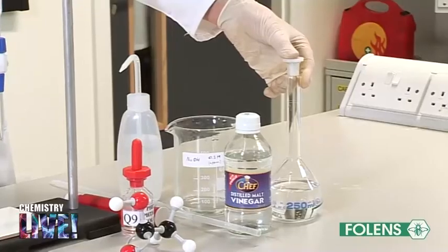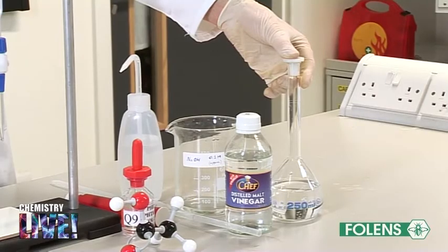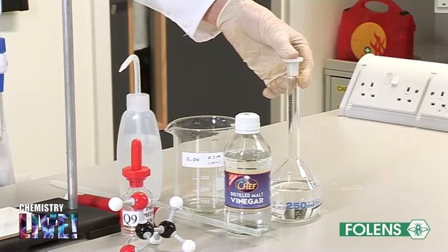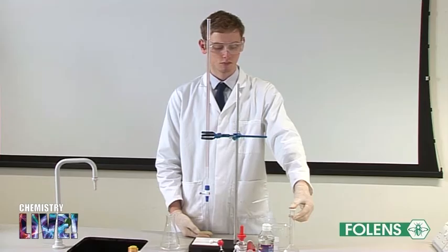The vinegar has been diluted by pipetting out samples of vinegar into a clean 250 cm³ volumetric flask and making it up to the mark with deionized water. Note that we have diluted the vinegar from 50 cm³ to 250 cm³—that is, five times.